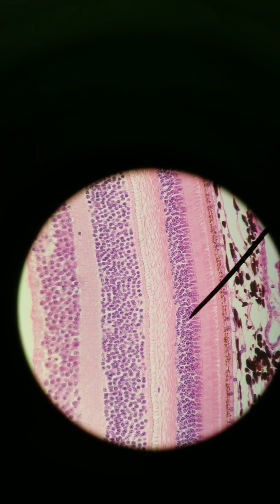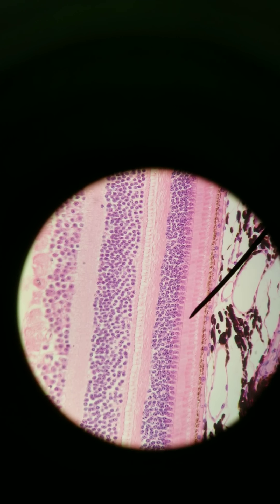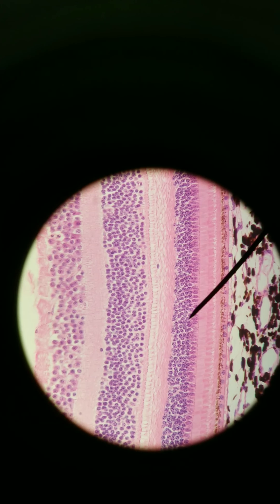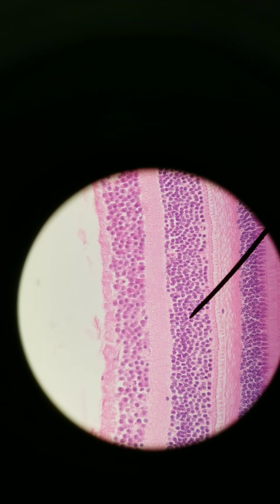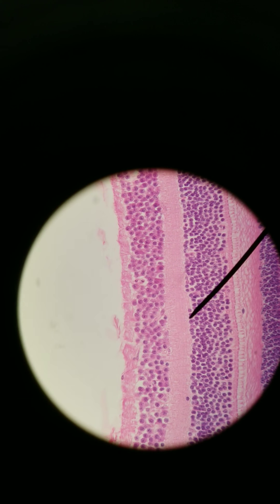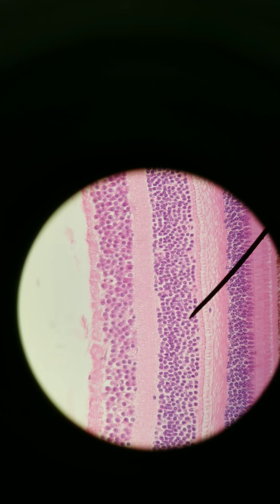Photoreceptors — they're rods and they're cones. We can't really see which ones are rods and cones without a really nice electron microscope. These are rods and cones, these are photoreceptors. They're light sensitive — photo means light. Photoreceptors, when activated, then activate these bipolar cells. These are neurons, and they're called bipolar cells because they have a bipolar shape. You've got dendrites over here and axons and axon terminals over here. These are bipolar cells. They're unmyelinated — they just need to go this really short distance.